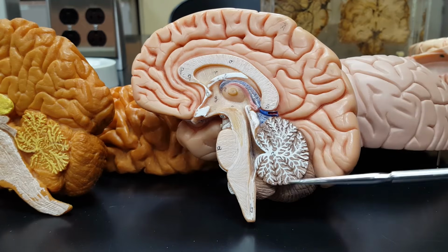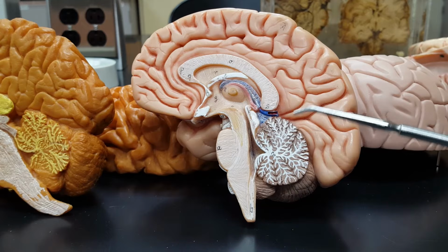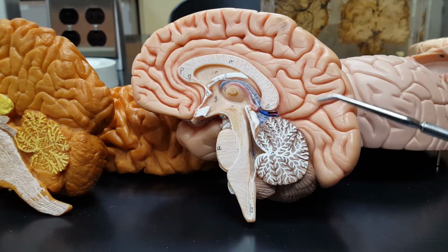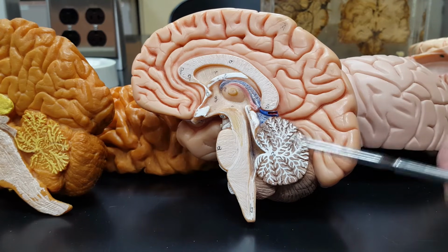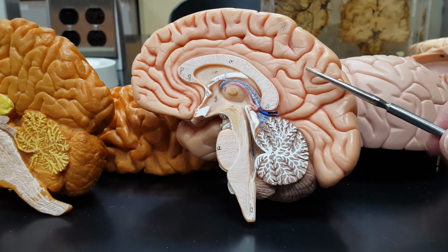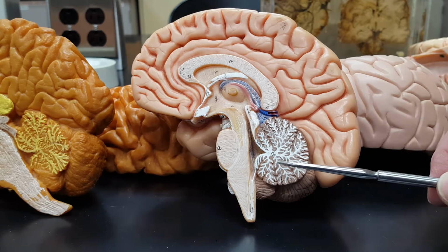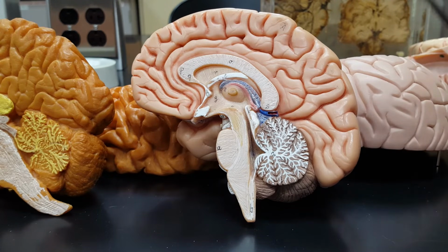So this brain part, the whole thing, is called the cerebellum. It's got a highly dense collection of neurons here. It's a lot of gray matter. Some people think that your cerebrum up here is the only gray part of your brain. No, this is a lot of gray matter. Think about all of its functions in your lecture.